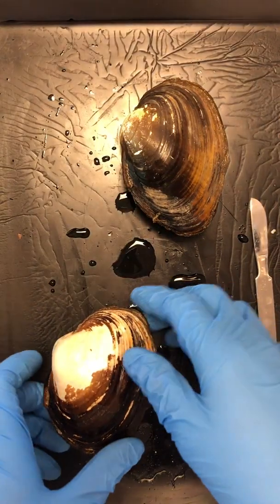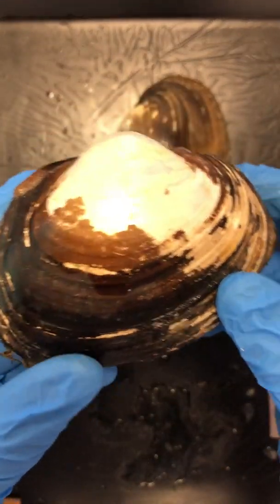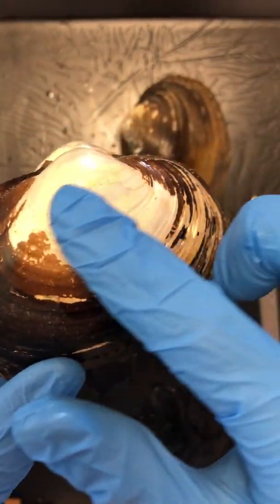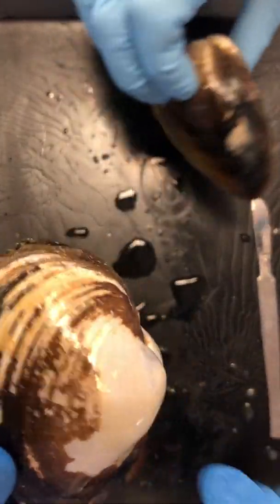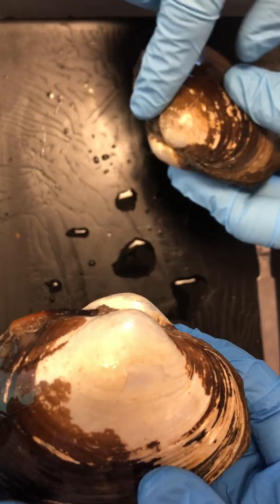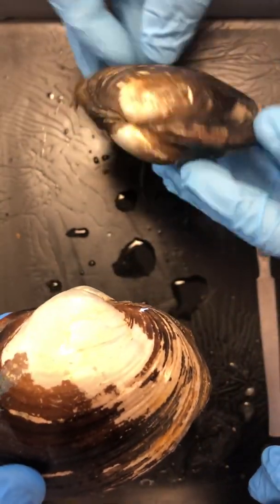Okay, we're going to start on the outside. If we look at this guy, where's my camera? Let's look this way. We're going to notice that he's got this funny hump here on the back, and then also on this side. Coach, can you find your funny little humps? Funny humps, nice. One of our funny humps is bigger than the other funny humps. Uh-oh. It's going to be this one.